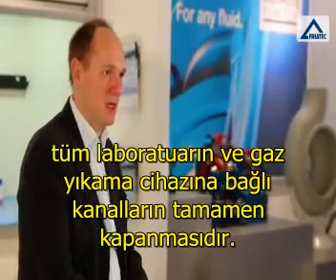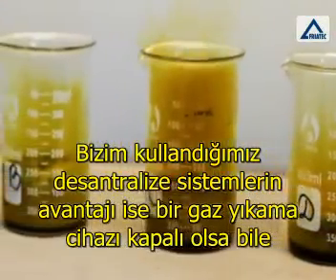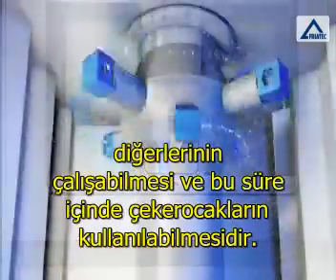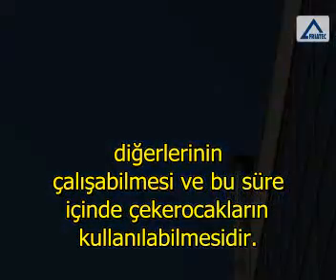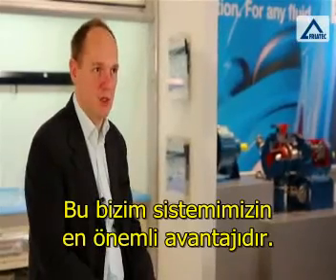In these decentralized systems we have the advantage that if one fume scrubber is off, the other fume scrubbers will continue working, and the fume hoods can also be used during this time. That's a big advantage of our system.